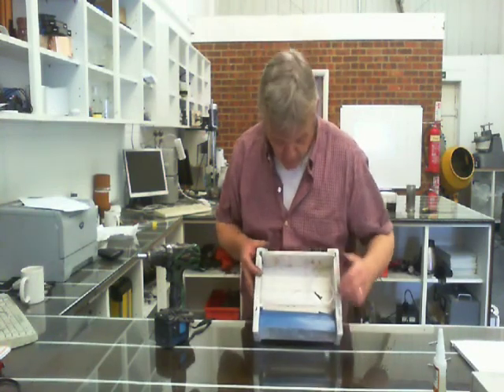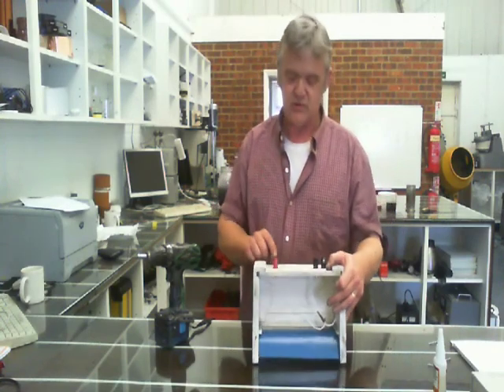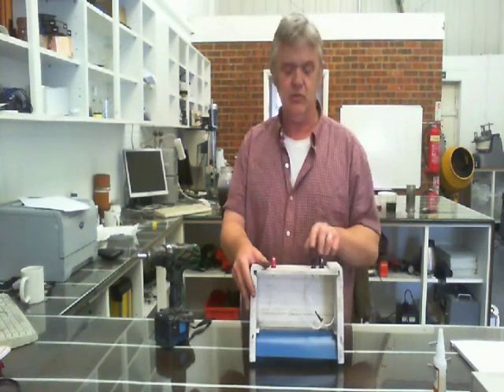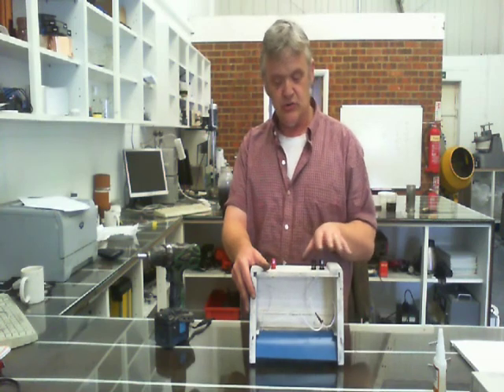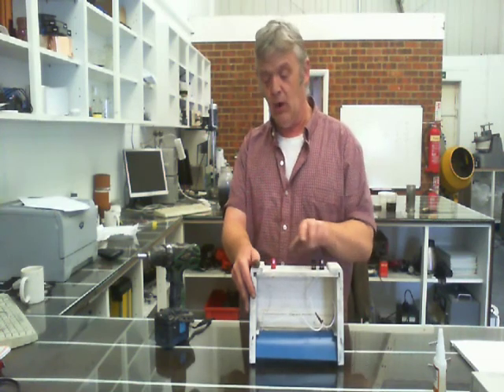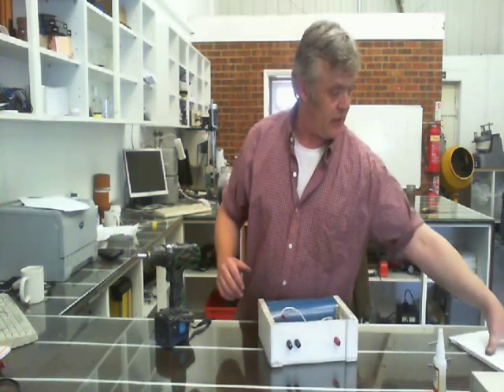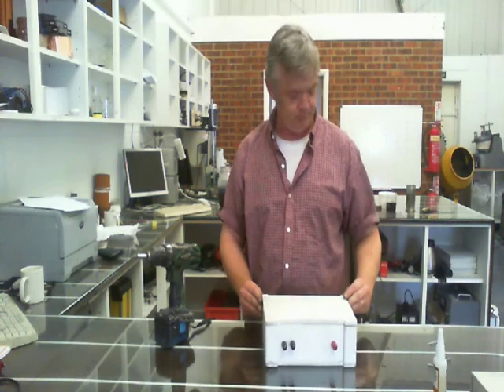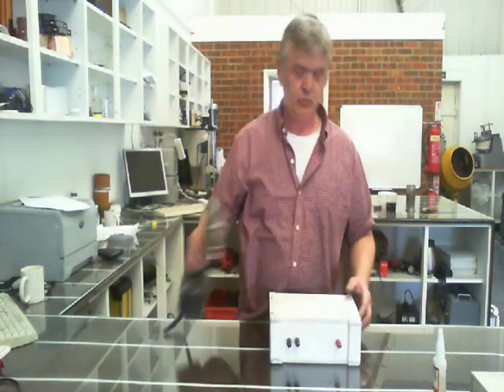Then all I did was take the wires from the lamp and lead them to these two banana plugs. So there's my high voltage, which I've done with a nice red banana plug to tell me. And there's my two lamps. Now, two lamps are both black because it doesn't actually matter which way around the lamps attach. So I've got my lamp power and my high voltage trigger. Then what I did was cut a base plate for it, a back plate for it, and then all I have to do is screw that on. And there we go, that's my lamp unit finished.